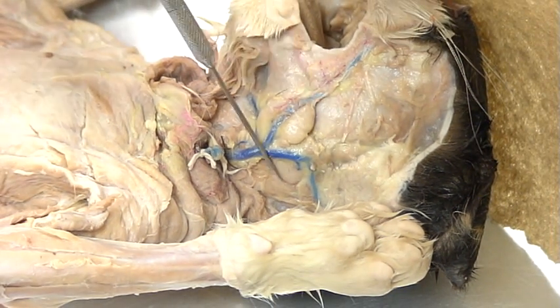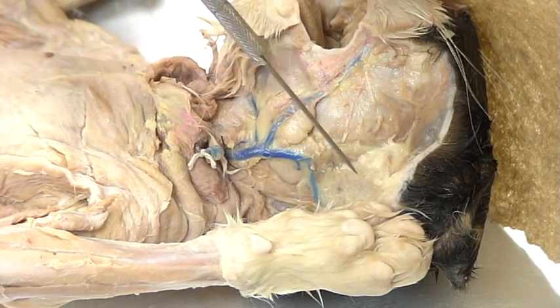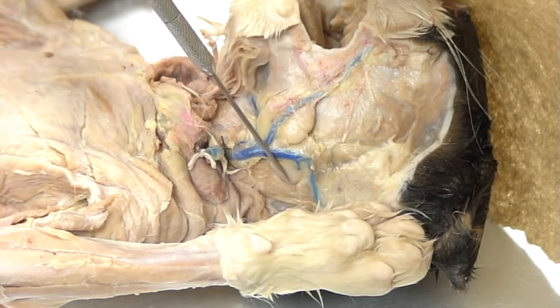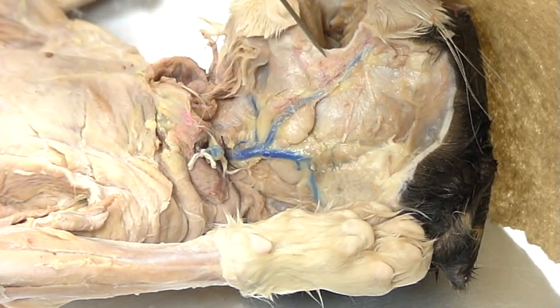These are the three digestive or salivary glands that you'll need to know: parotid, submandibular, and sublingual.